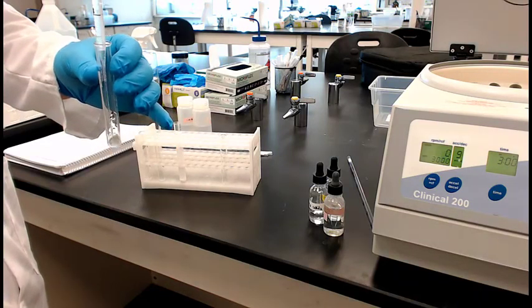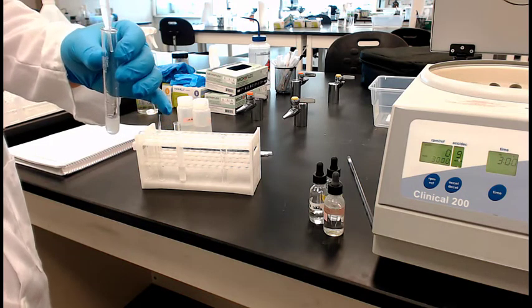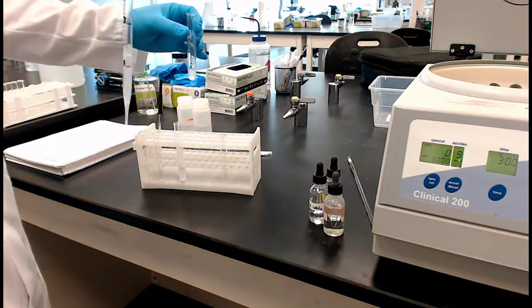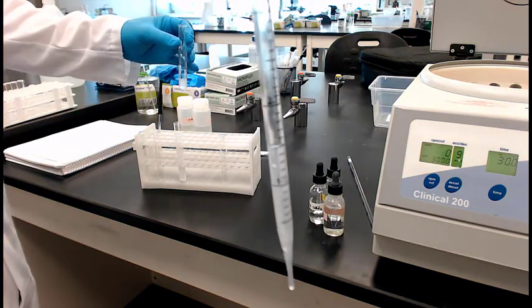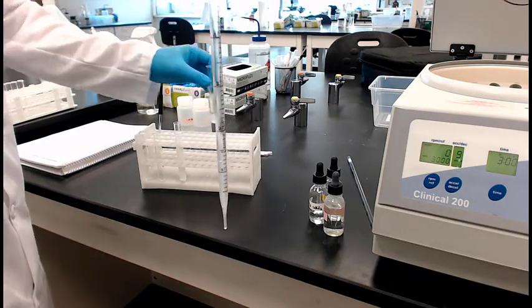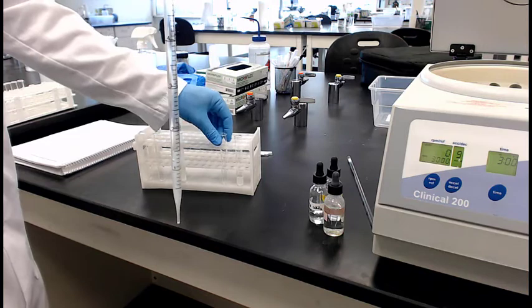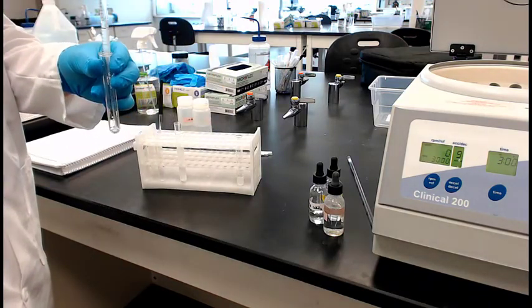That's a little safer. And by the way, he's doing that for the video, but you could do it in the test tube rack. That's even safer yet, right? So some of it into one tube. There we go. About 1.5 mils each. This is step number 4 in your instructions. Here comes the second part. That goes into this tube.